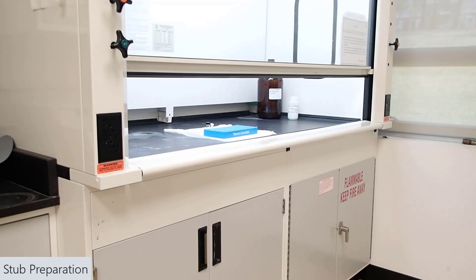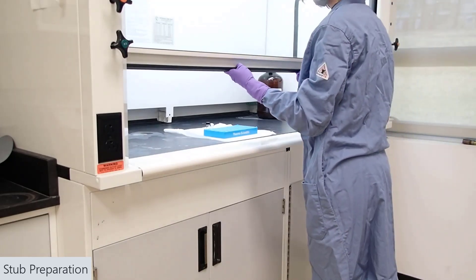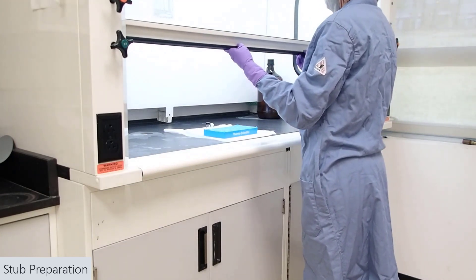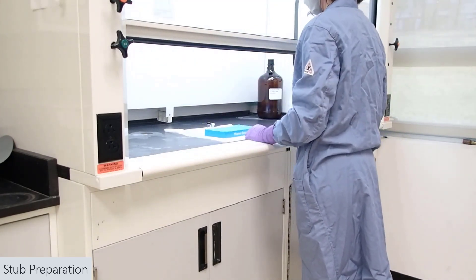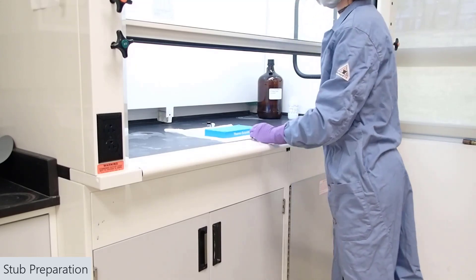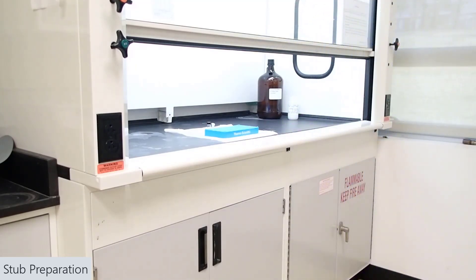Now, to begin, we are working with powder materials, so it's best to do all of the sample prep within a fume hood because nanoscale materials can be harmful to human health. For the rest of the video, I'm not working in a fume hood because I'm working with non-toxic materials as an example.